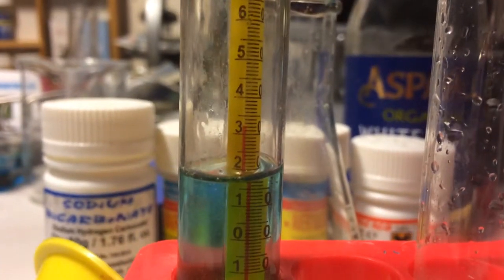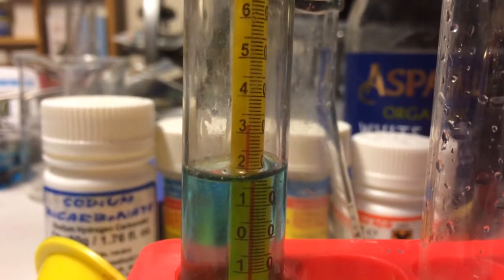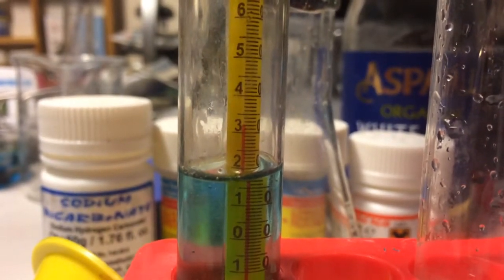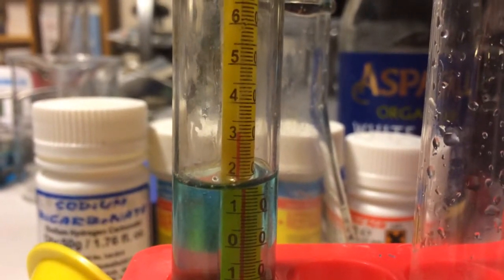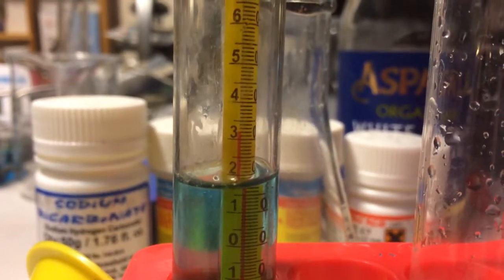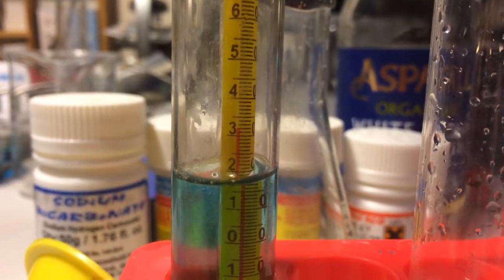Now that we have mixed it more, the temperature is 32 degrees Celsius. This means that an exothermic reaction took place because the temperature raised after the reaction.